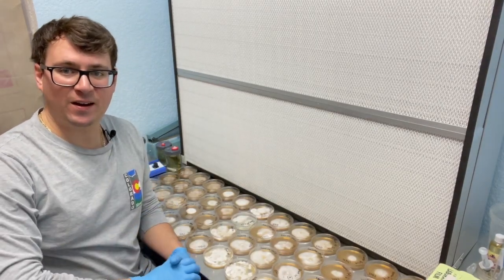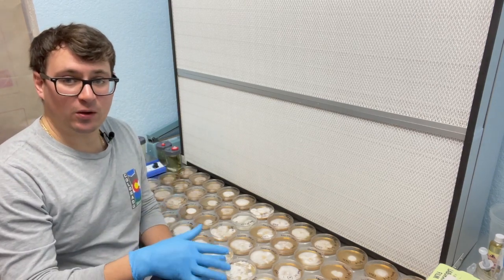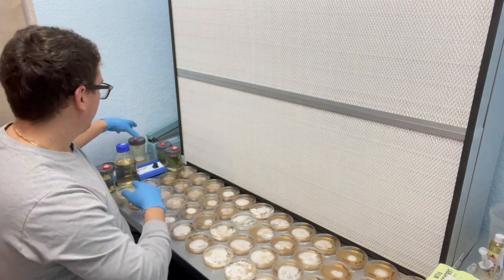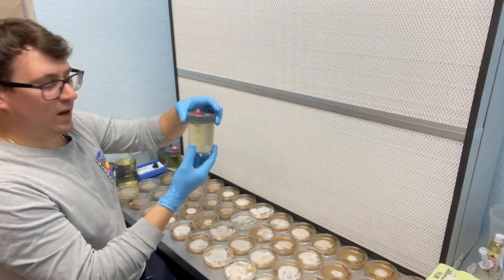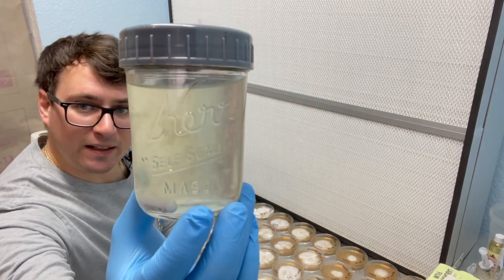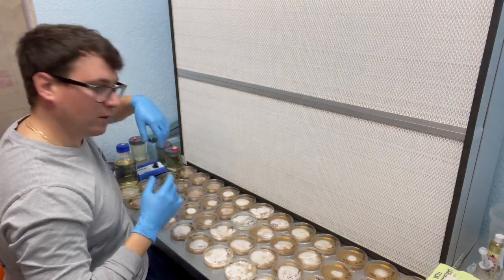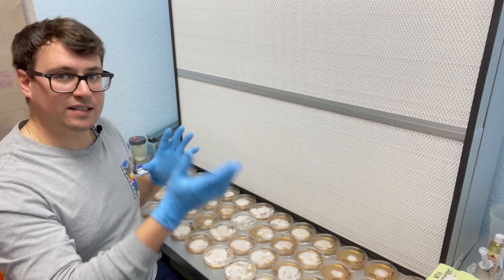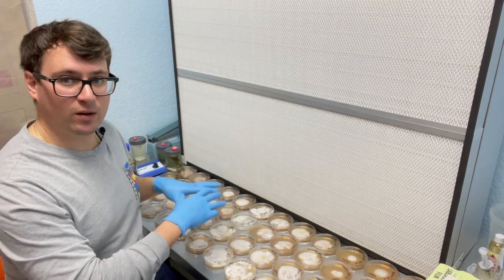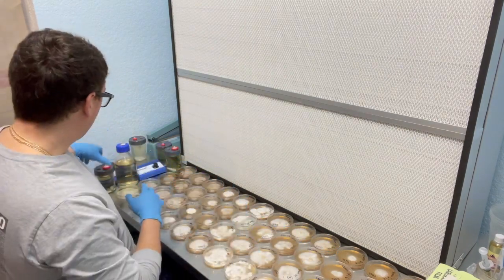What's up mushroom fam, it's Gary with Fresh from the Farm Fungi. I'm here in Denver, Colorado. Today I wanted to show you how to inoculate mycelium into a liquid culture. In a previous video I showed how you could dilute spores and inject them into a liquid culture to form mycelium, like this king stropharia here. But if you want to be extra sure you're using sterile tissue, you'll want to start the spores on agar, separate them out, and inoculate them into a liquid culture.